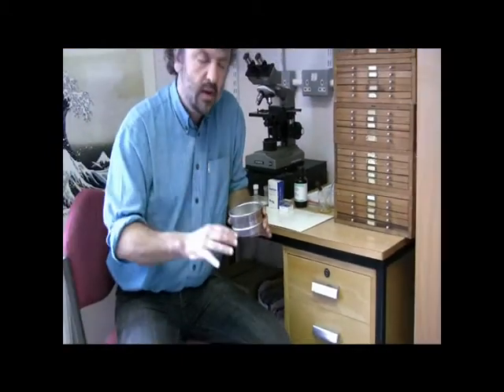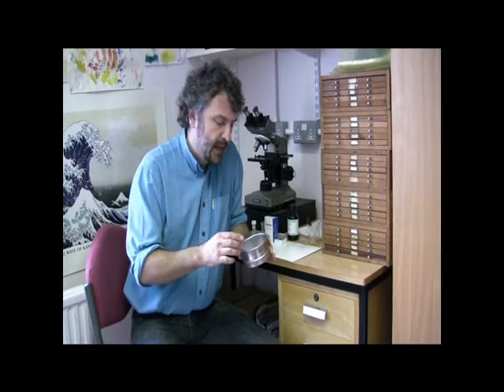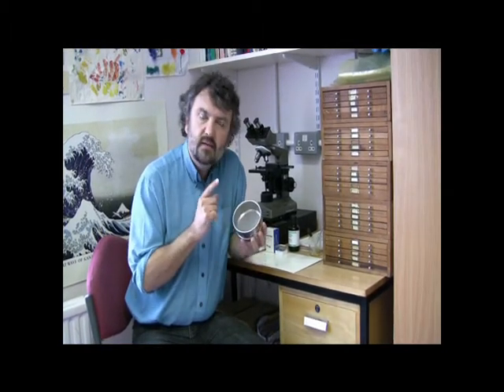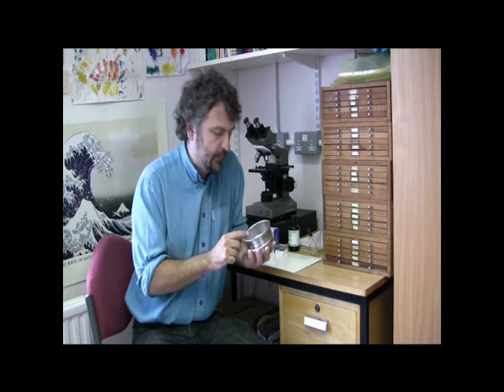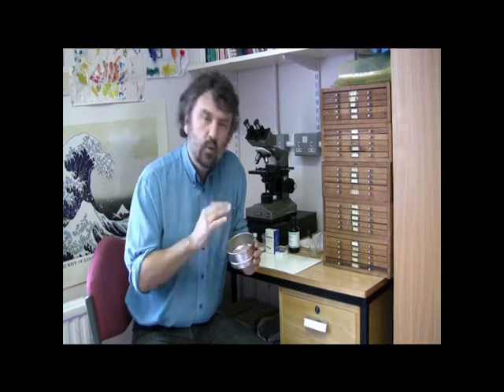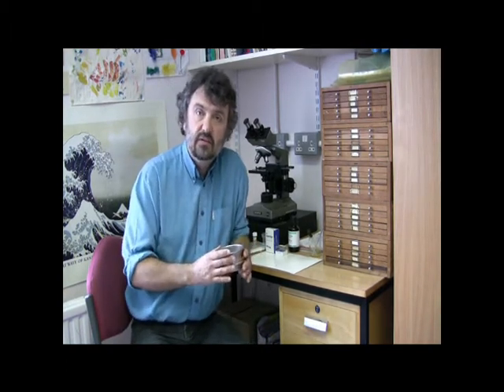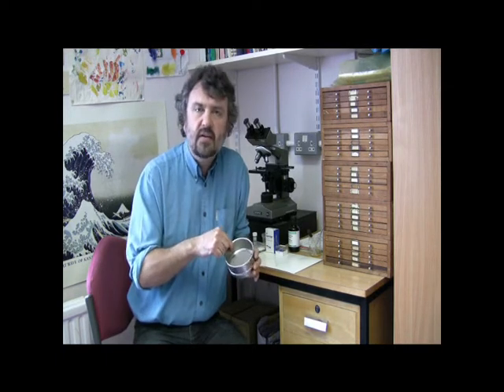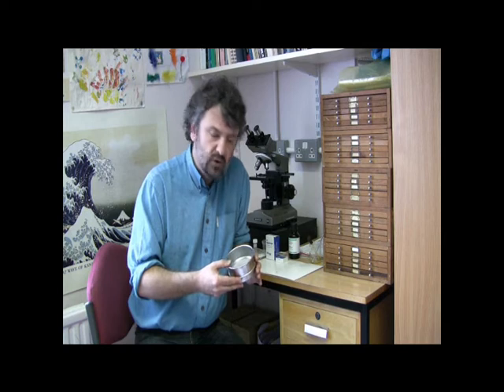This material is valuable so we don't get rid of it, we keep it. The material on here is what we want to retain for our examination. But within that washed sediment there will be radiolaria, which are siliceous microfossils made up of opaline silica. But there will also be lots of other types of microfossils like planktonic foraminifera which are calcareous, calcium carbonate in composition.